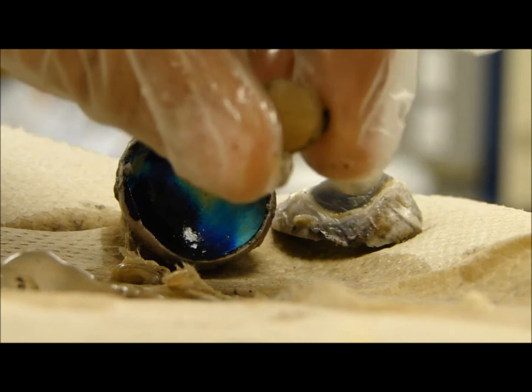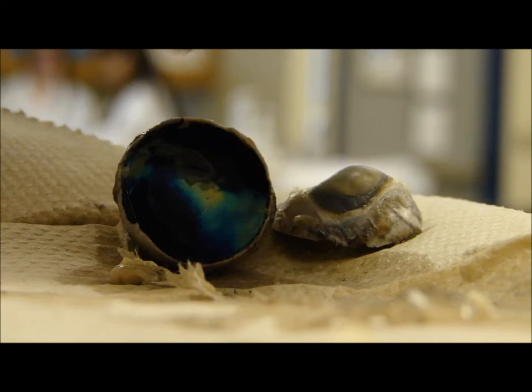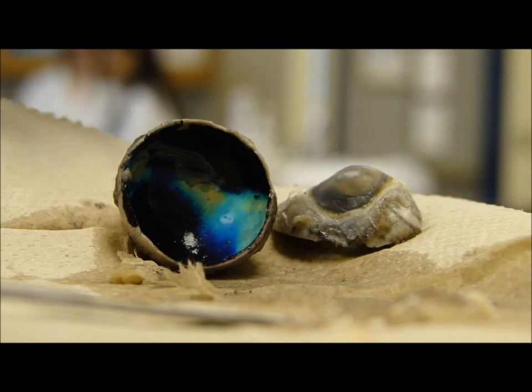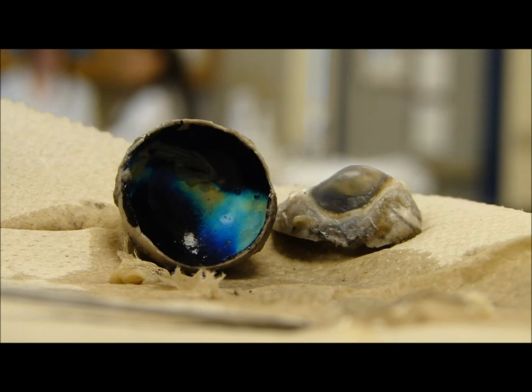Alright, so we got the lens. Pat it dry. And now we're patting it dry. It's hard. We still have a little section though. Alright, let's try. It says it works best if you let it dry overnight, but I don't think that's gonna work.